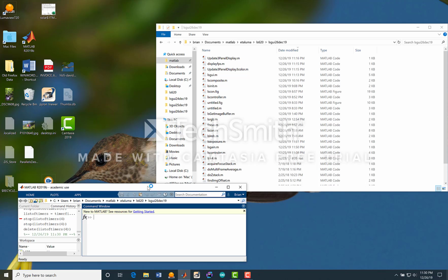The first thing is initialization, ls init. Takes a few seconds. I think I figured out how to get this working right all the time, but always check still. Image equals ls get image buffer, and I guess I don't have it because it doesn't work.